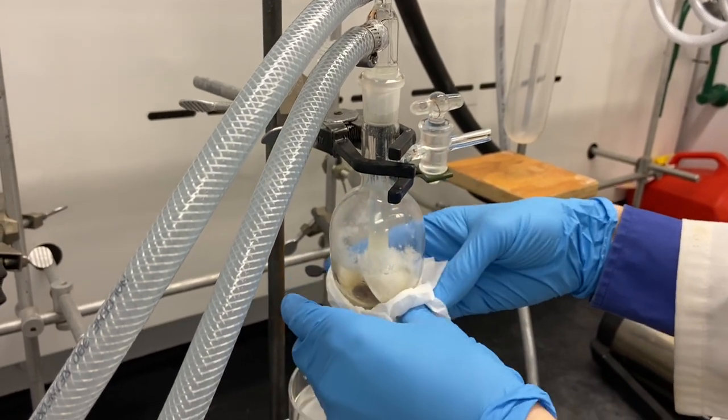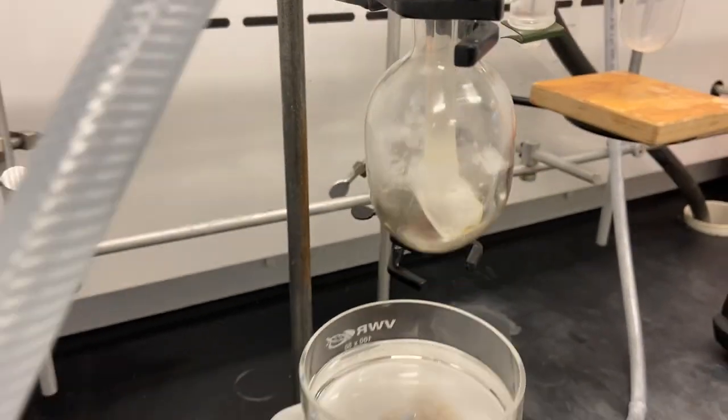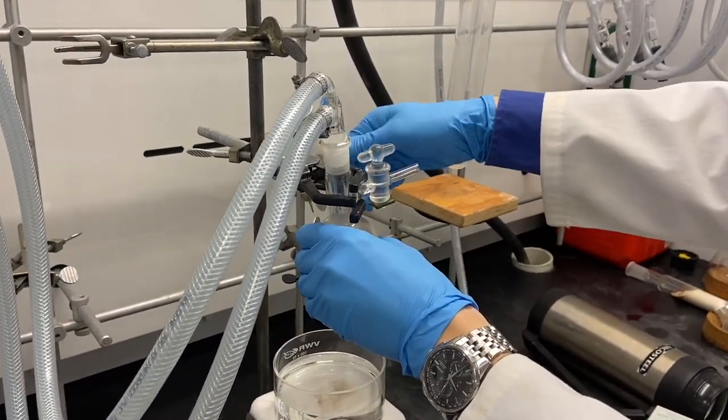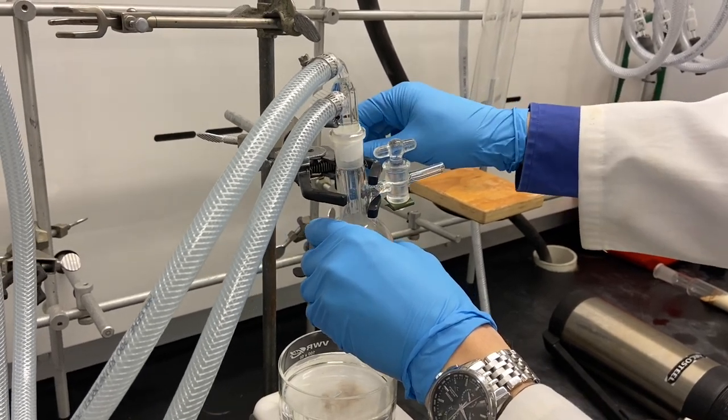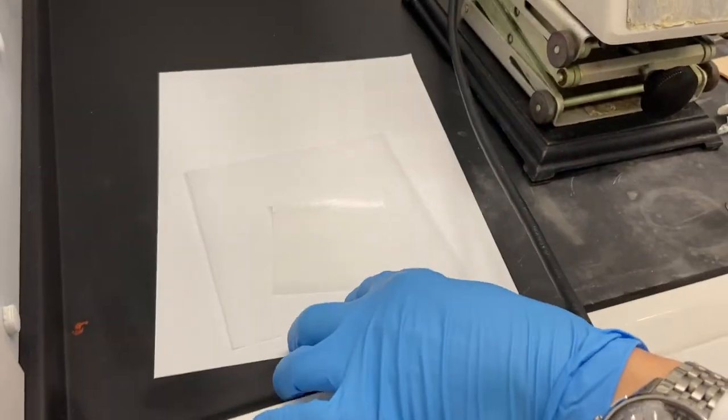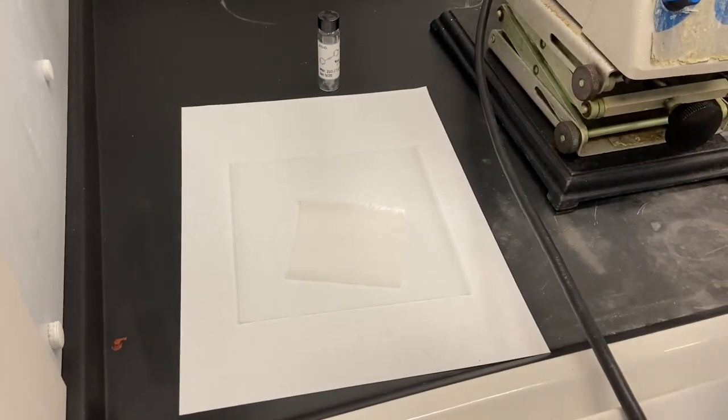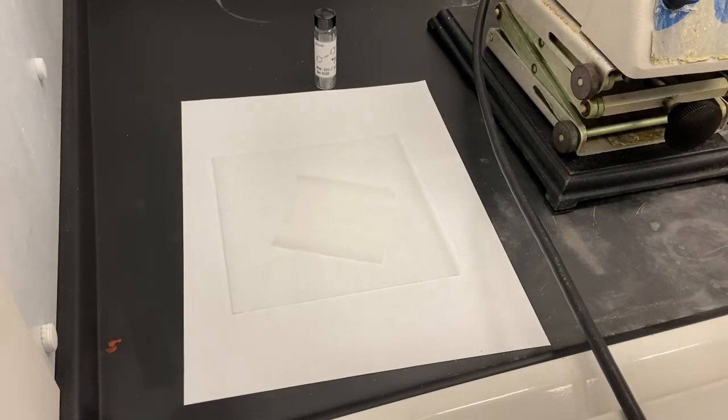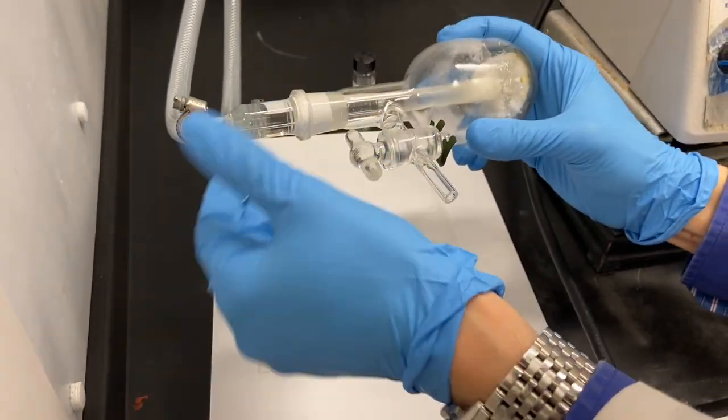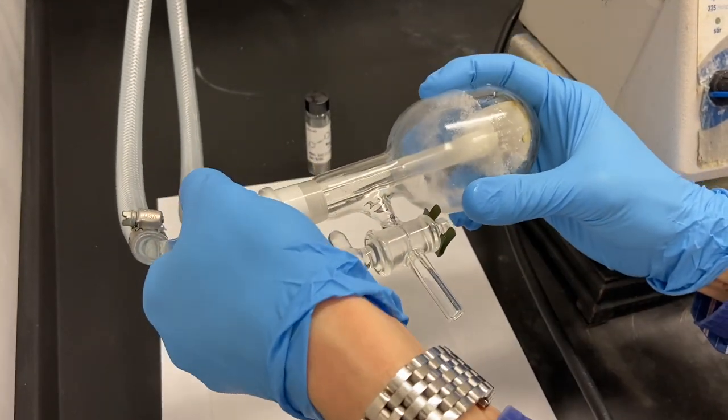A good idea to clean off the oil a little bit. Very carefully try to get it all out. I like to put some ordinary paper down to catch anything that falls to the side. I have a little vial prepared here and we'll try to get it all in there. First thing is I like to put it to the side a little bit so that the stuff doesn't fall back to the ground. And now carefully I remove the cooling finger.